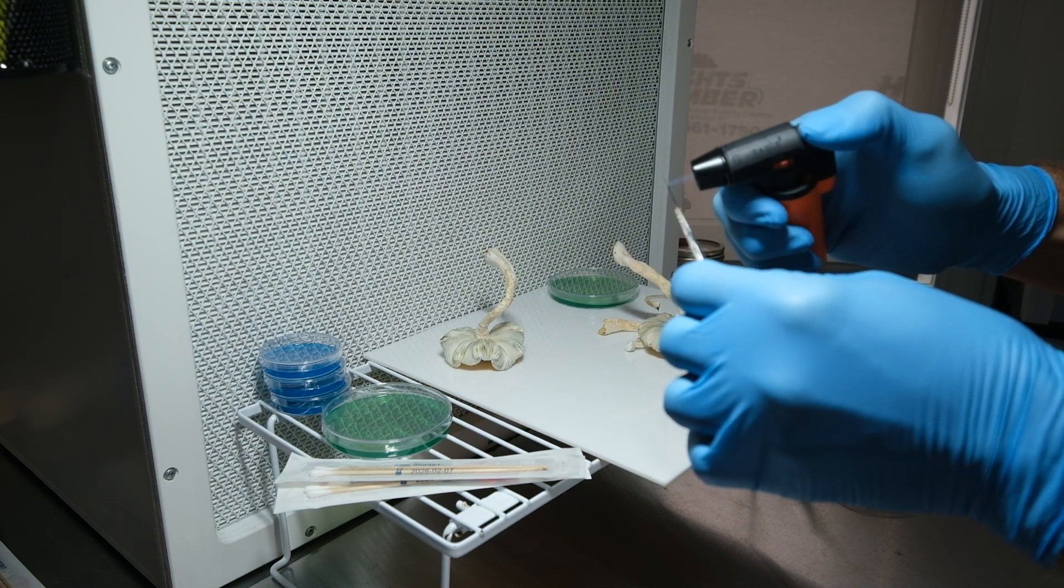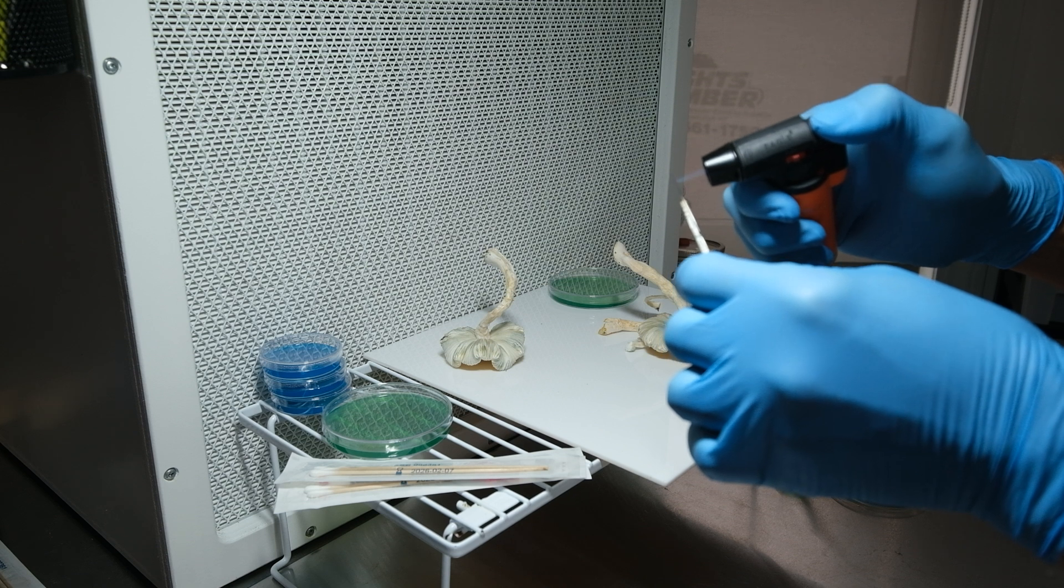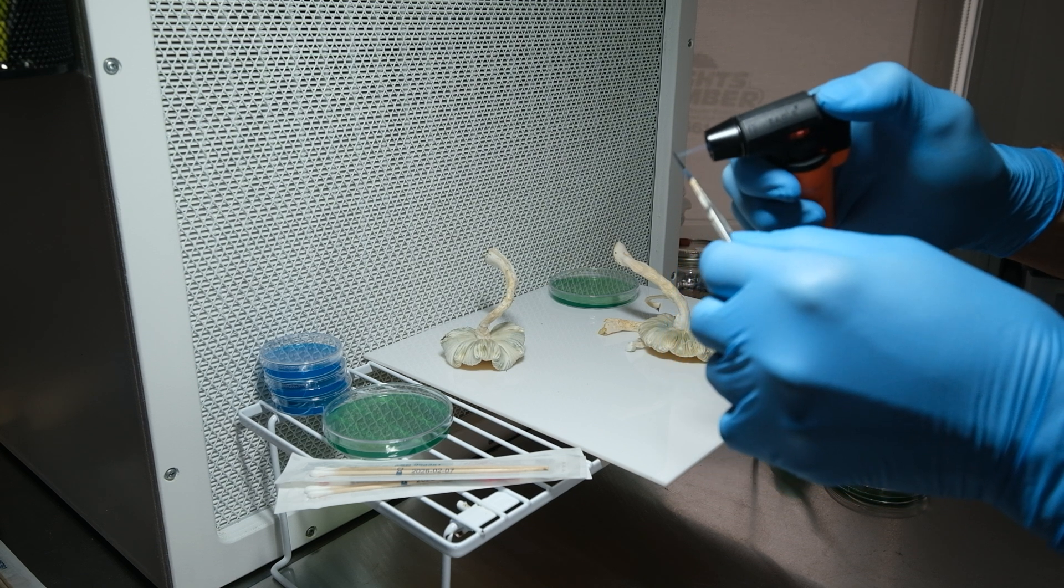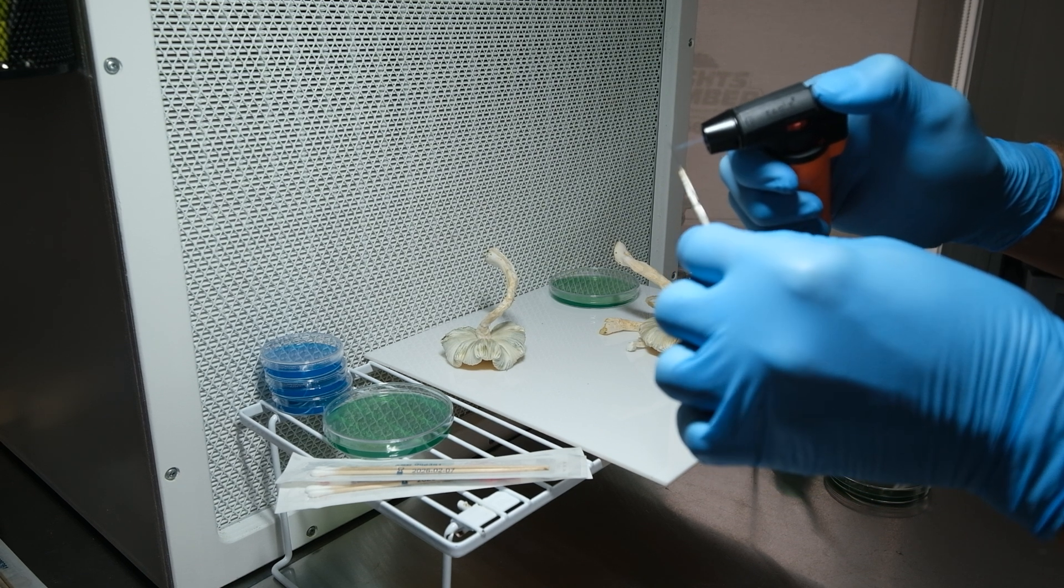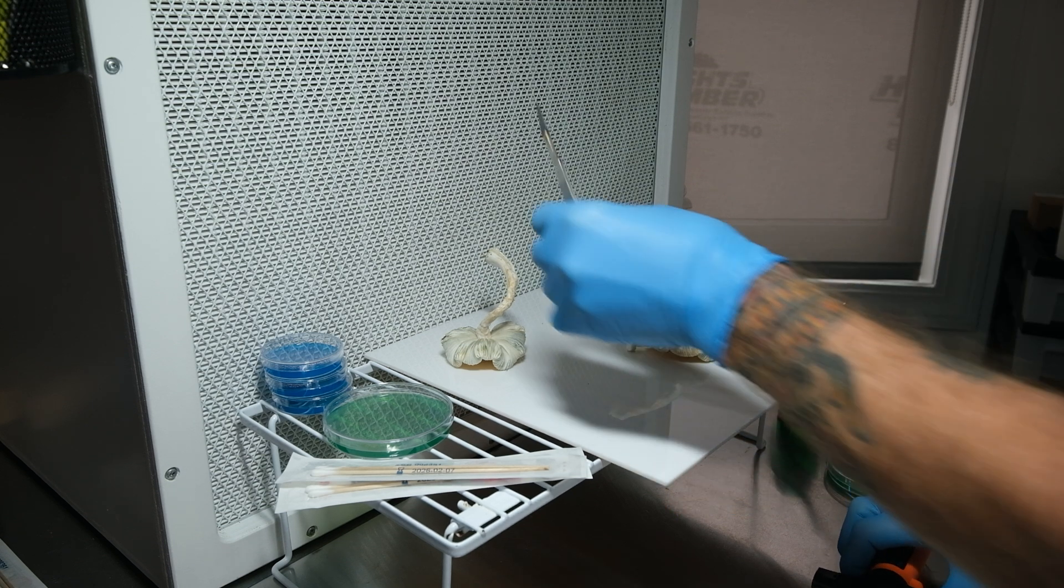I'm gonna flame sterilize my blade again in between each different use of it and we're gonna do the same thing. We're gonna split the stipe open.